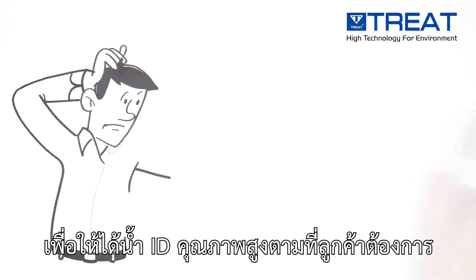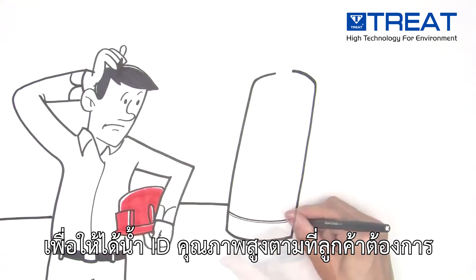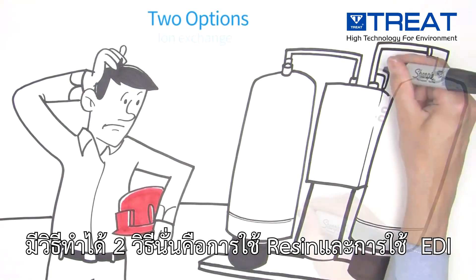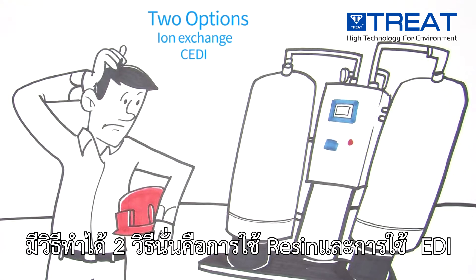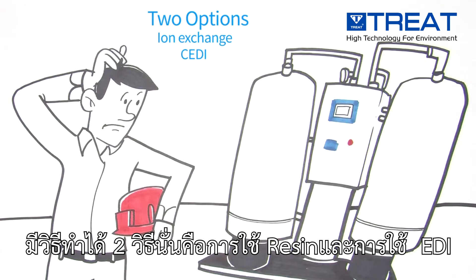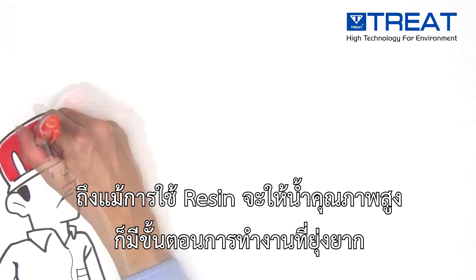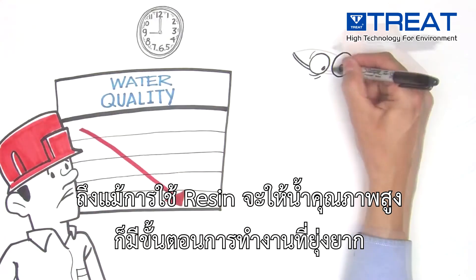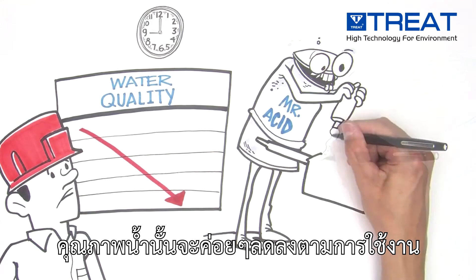To meet end users' requirements for high purity deionized water, there are only two options: ion exchange or continuous electrodeionization — CEDI for short. While ion exchange will provide high purity water, it's a batch process, so quality begins high and declines.